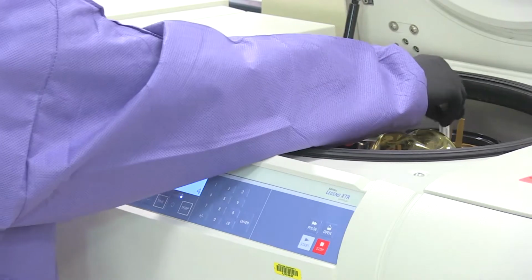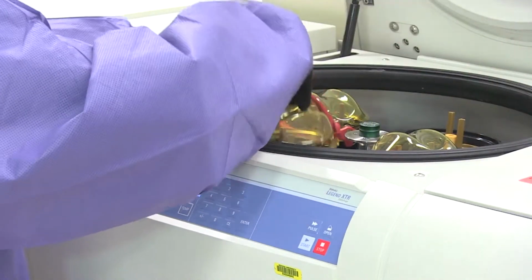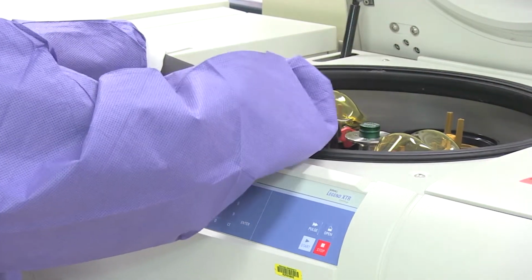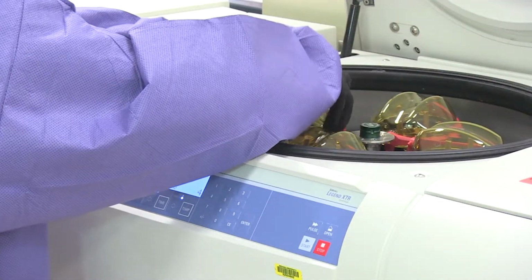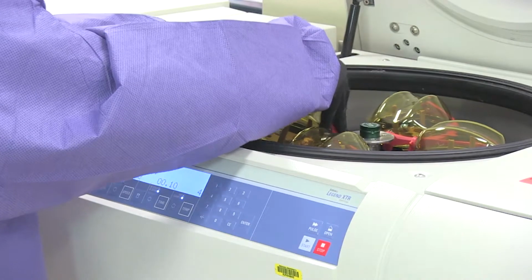After your tube is clotted, you're going to load your centrifuge. Place the tubes into the bucket and secure the lid. Make sure that the centrifuge is balanced and close the lid tightly.